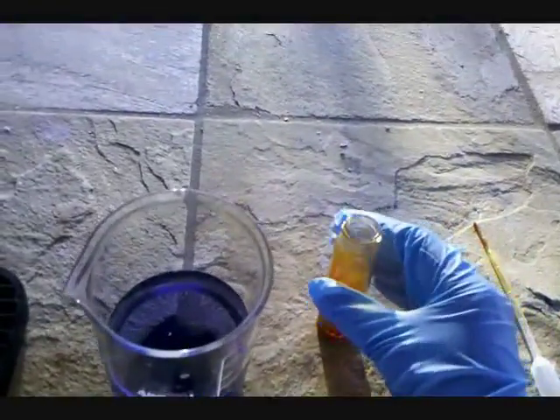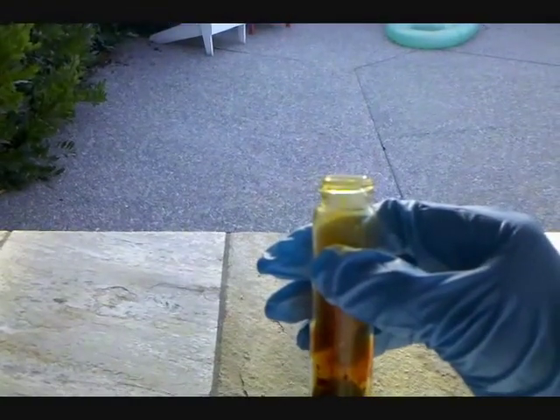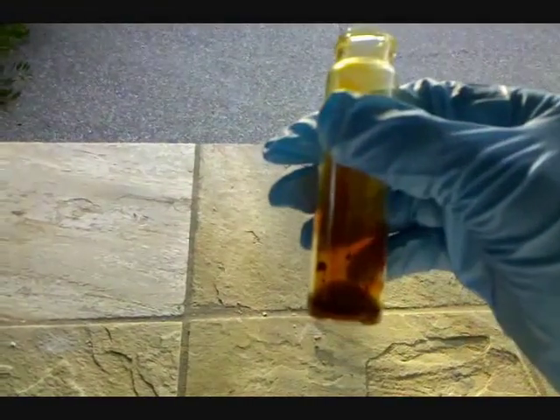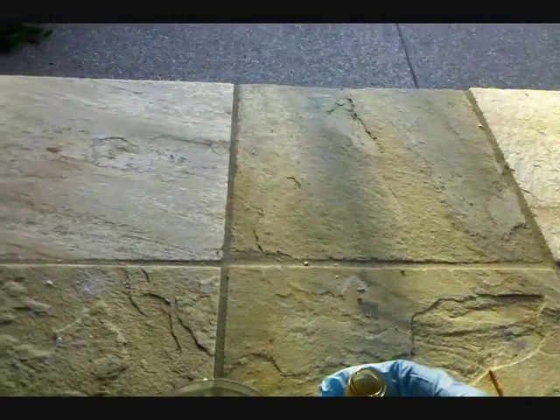So that is a basic overview of the synthesis and properties of chromyl chloride. The fumes that you can see coming out of the top of the vial are hydrogen chloride from excess sodium chloride.